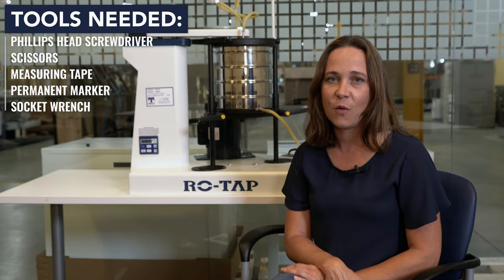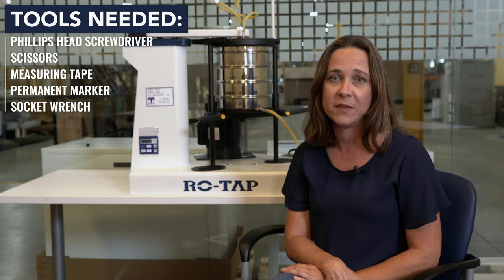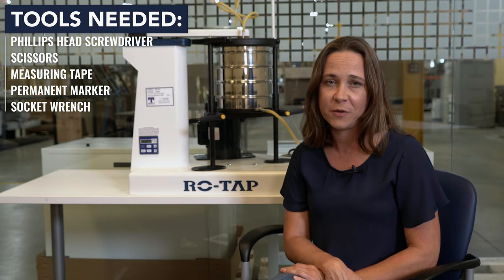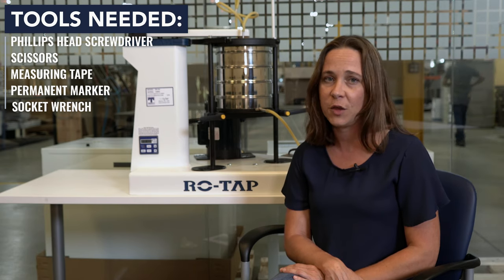Hi, I'm Candace from WS Tyler and I'll be your particle analysis guide today. The ROTAP sieve shaker is widely known for producing accurate dry sieve analysis results. However, it can also be used to perform accurate wet sieving test results. Today we'll show you how to install a wet test sieve analysis kit onto your ROTAP sieve shaker as well as how to perform a wet sieve analysis so you can begin to yield sieving results that are accurate and repeatable.